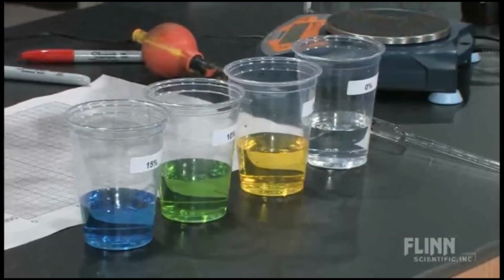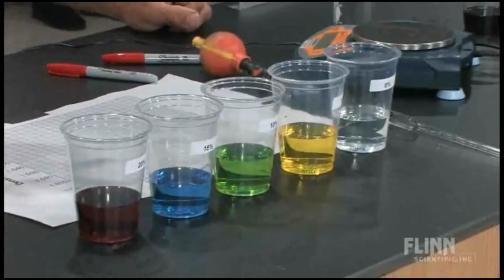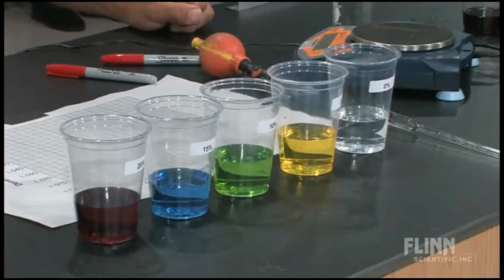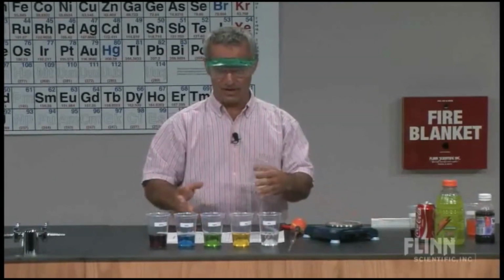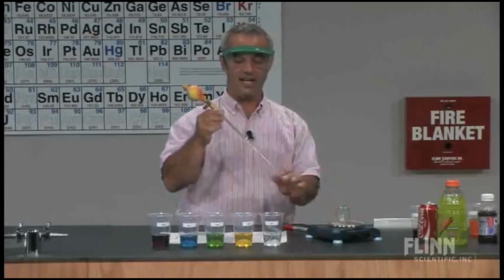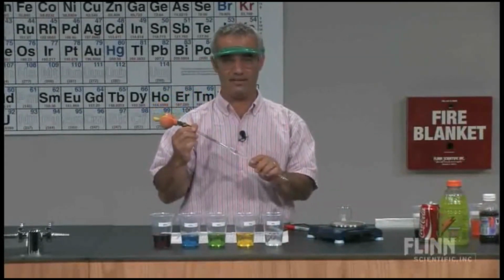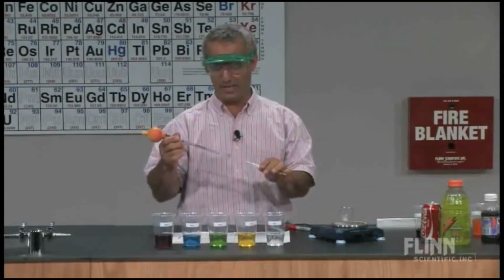That's just to help the students keep track of them. They're also in labeled cups. That's just a little bit of food coloring, too little to have any influence on the density. One of the things this lab also does, along with tying in density and sugar concentration, is teach a nice technique, that is how to use a volumetric pipette, not by mouth either. I know these are all things that could be consumed, but that's not done in the lab.